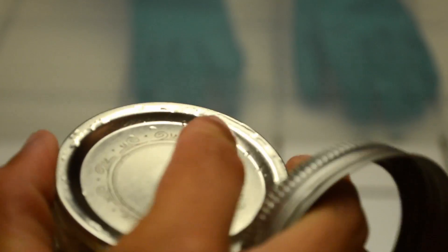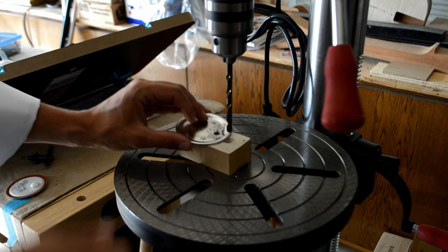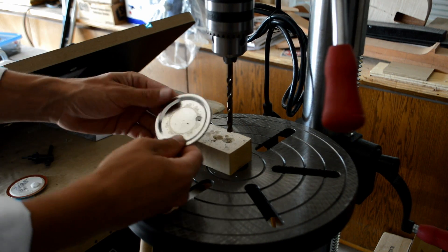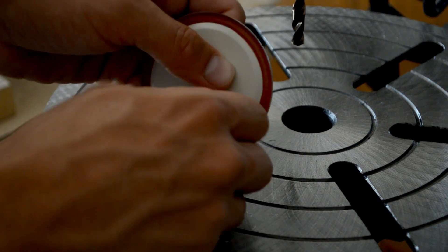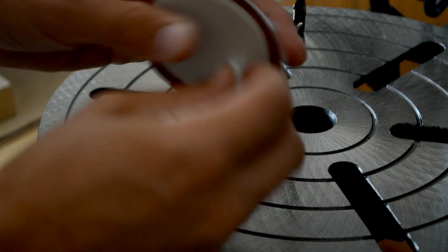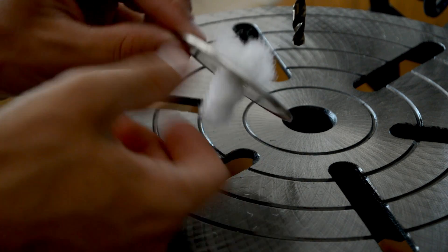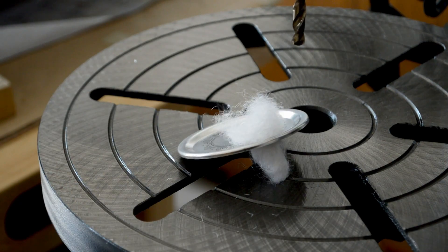In this tutorial we will outline five methods which we can use to inoculate a clean agar plate. Before we begin, we should note that we have drilled one pencil-sized hole into the lids of all of our mason jars and filled them slightly with polyfill. This will act as an air exchange port that will effectively filter out all outside airborne contaminants. This should ideally be done before the agar is poured into the jars in order to cut down your chances of contaminating your agar by exposing them to the air while you switch out your lids.